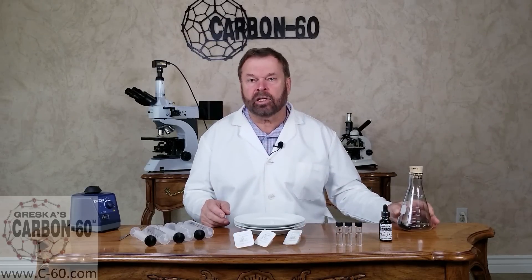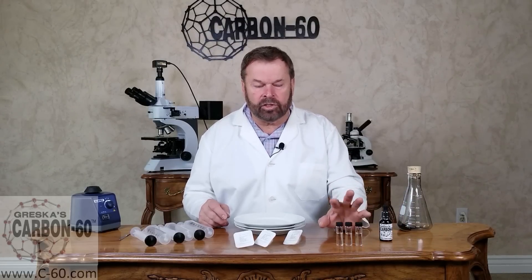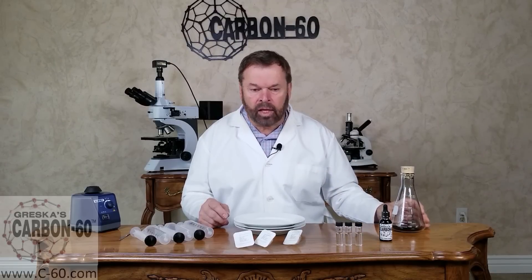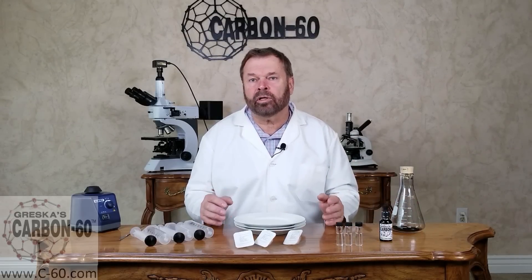Basically, the difference is the polarity on a solvent. We have three solvents here. There are three types of solvents: polar, non-polar, and dipolar solvents. They have a charge on the solvents, and that charge directly relates to the carbon 60 particles or molecules. It plays an important determining factor of whether the carbon will pass through the filter or not.